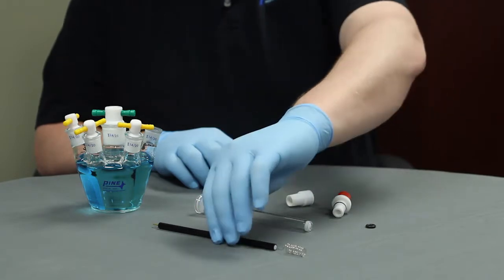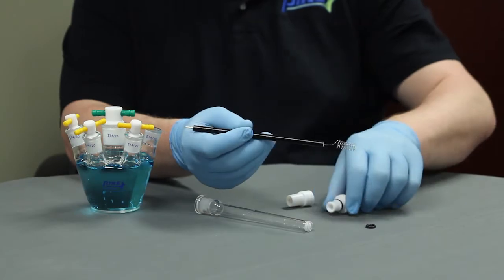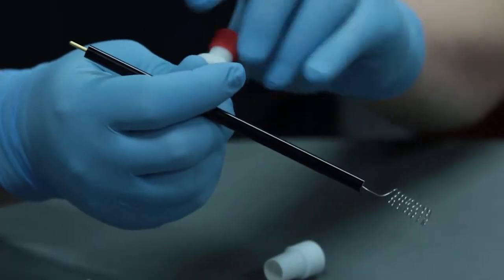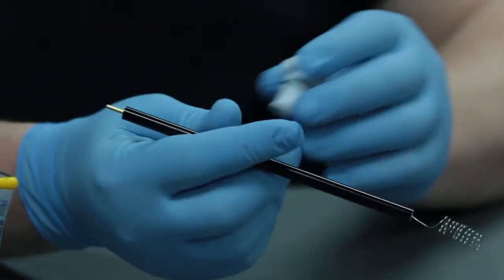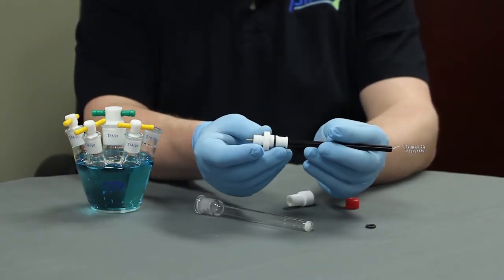First, obtain your platinum counter electrode, then grab the outer Teflon adapter and slide onto the electrode shaft.